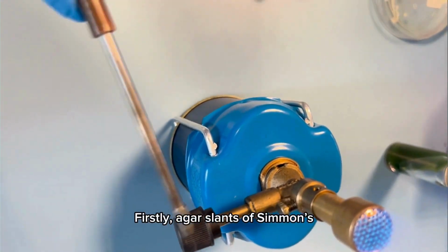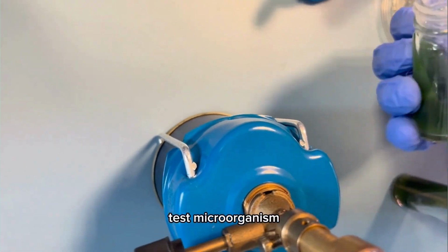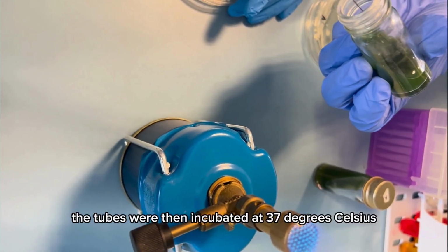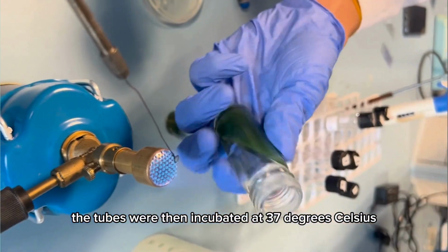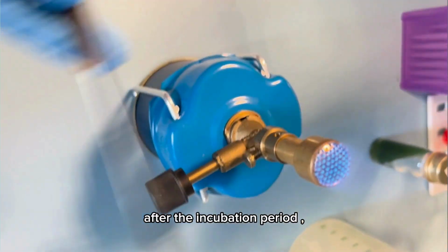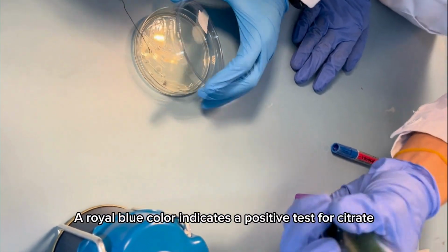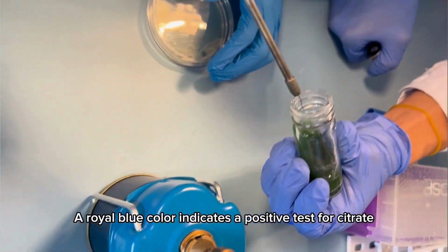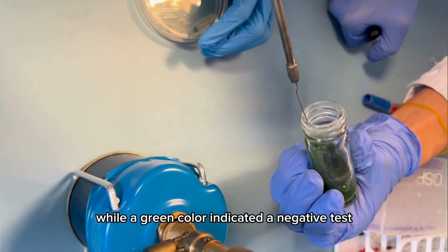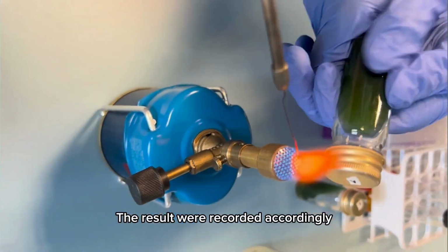Firstly, agar slants of Simmons citrate medium were inoculated with each test microorganism. The tubes were then incubated at 37 degrees Celsius for 24 to 48 hours. After the incubation period, the color of the tubes was observed. A royal blue color indicates a positive test for citrate utilization, while a green color indicates a negative test. The results were recorded accordingly.